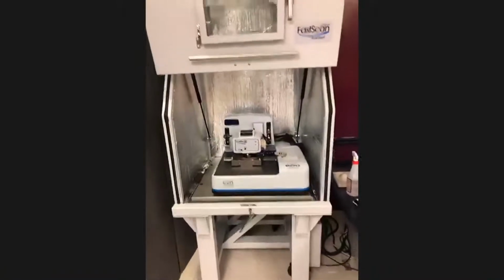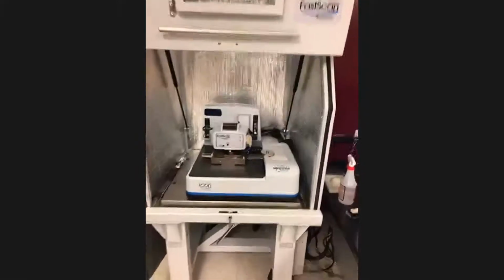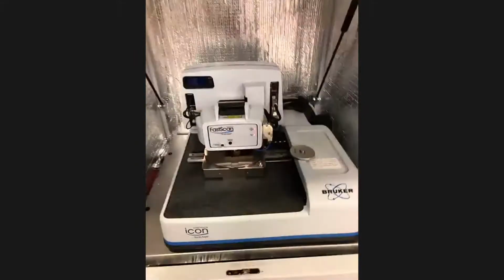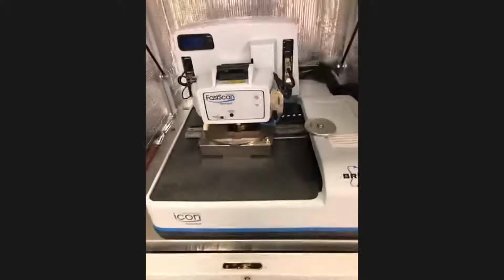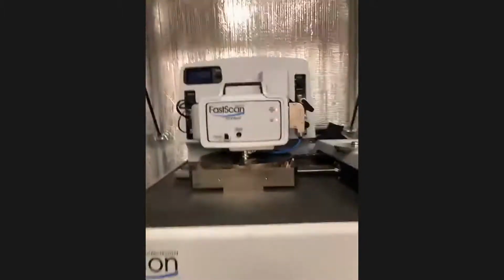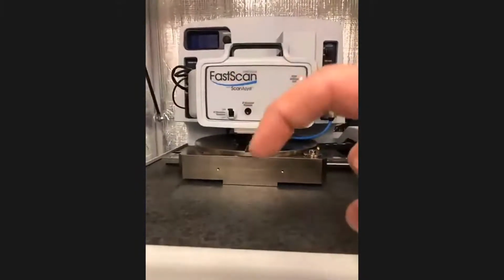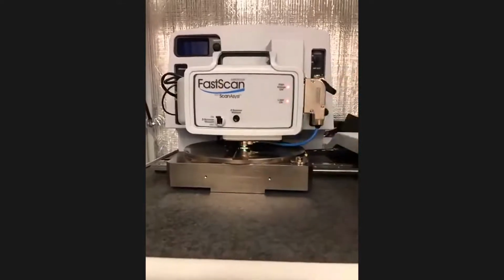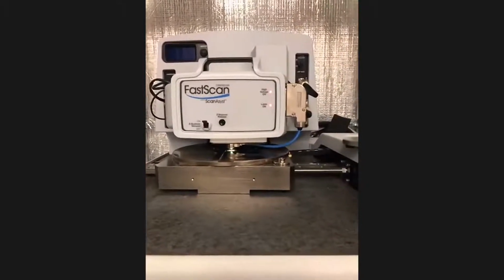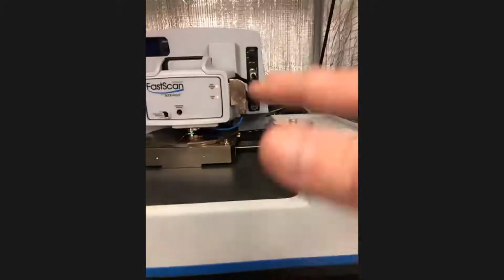So this is an atomic force microscope or a scanning probe microscope. I'm not going to have time to get into the details of it, but you can imagine that it's also very sensitive. It's sort of like a record player, right? In the sense that instead of turning the grooves on a record into sound, it's turning the bumps on the surface into images. And so there's a small sample down there with a tiny little finger that's touching down and scanning across the sample. We'll actually see that finger in a second. It's called a cantilever. But the whole microscope is, again, floating on one of those optical tables that stabilizes it. It's inside of an enclosure to keep out electromagnetic and acoustic noise.